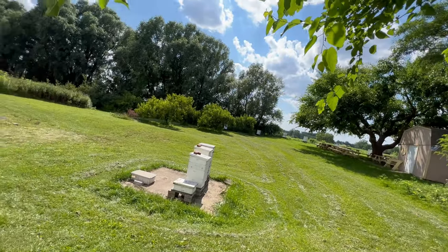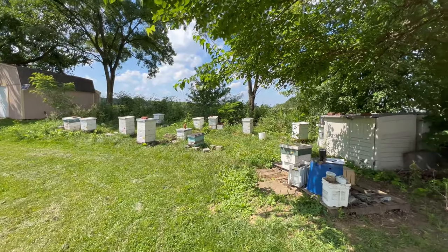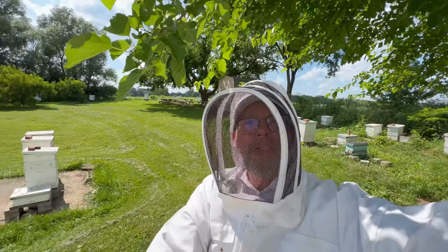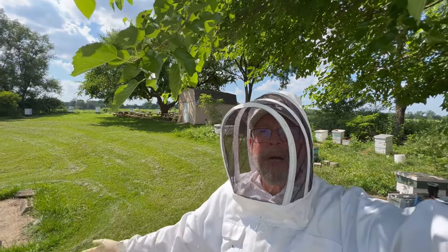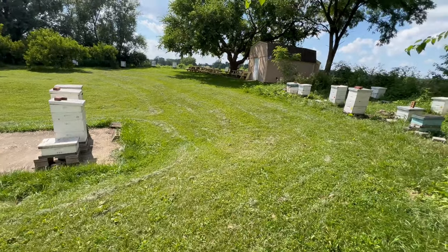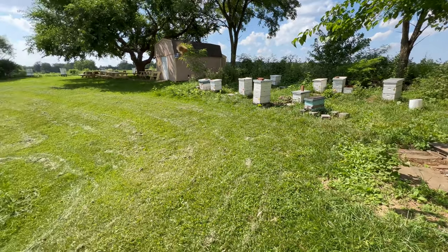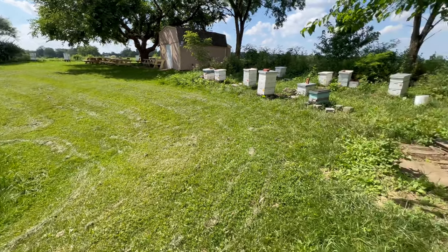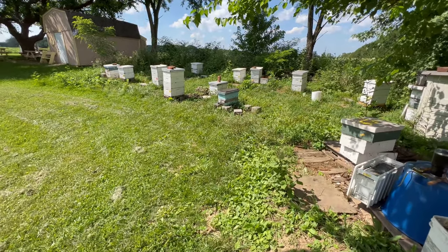Even when I'm doing something like a test for parasitic mite infections, I have to say this is such a marvelous place to be. It is such a wonderful opportunity to come here and spend time in the apiary at the Rothenbuehler Lab. And as I started this video by talking about Walter Rothenbuehler and his coining of the phrase hygienic behavior, let's take a look at these numbers and see how hygienic our colonies are here.